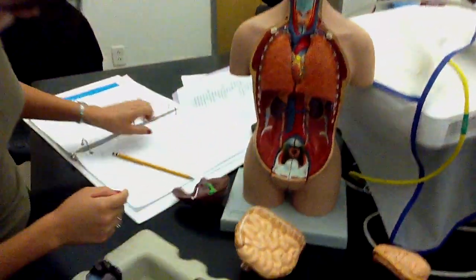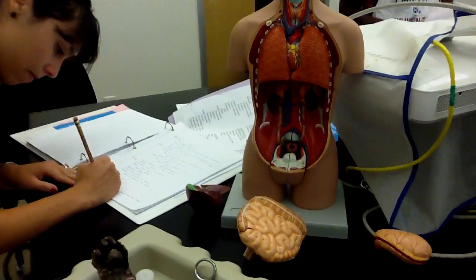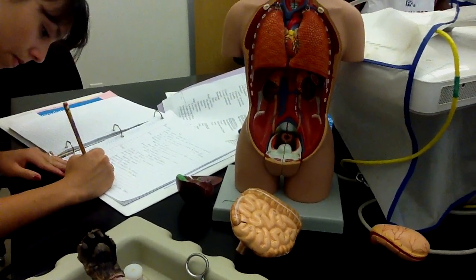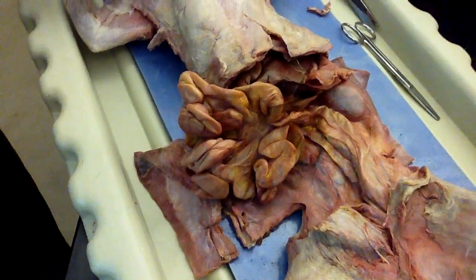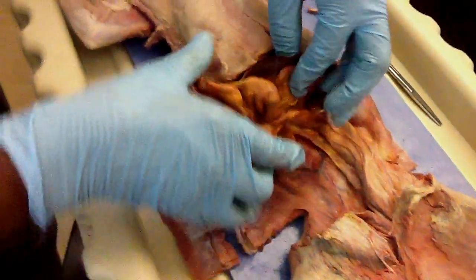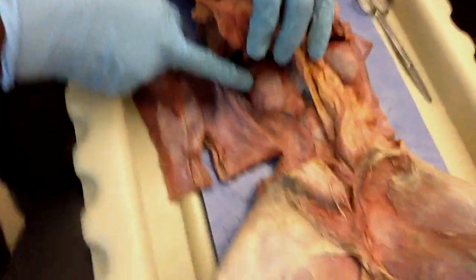Oh, okay. That's three. The kidney. Left and right kidney. Wait. Where's the other kidney? Turn to the other page, 53, in your book. Oh, there it is. Very nice picture of the abdominal cavity with all the organs removed.